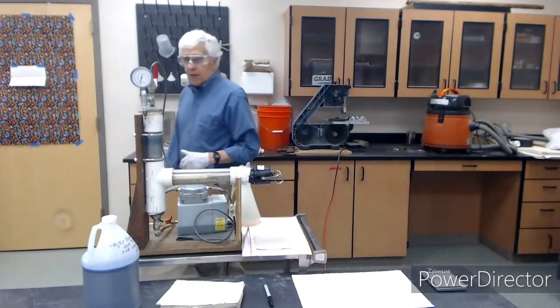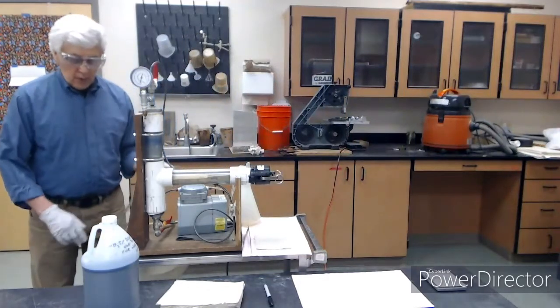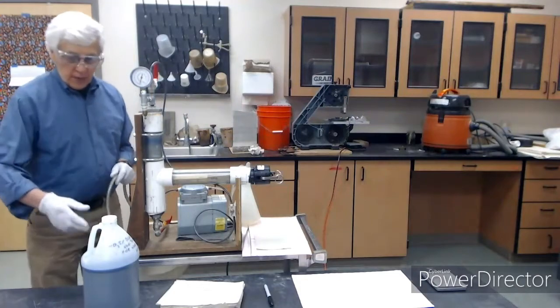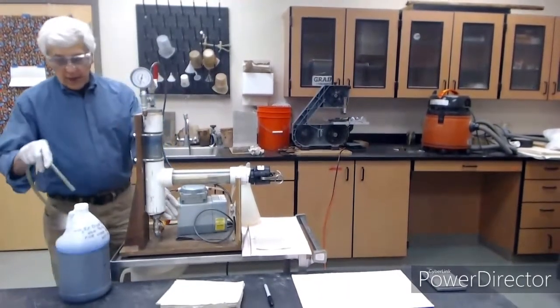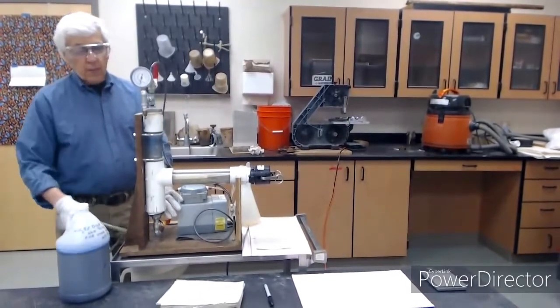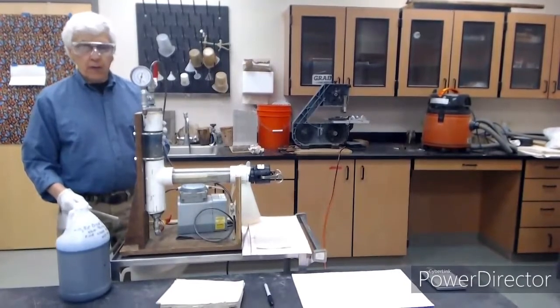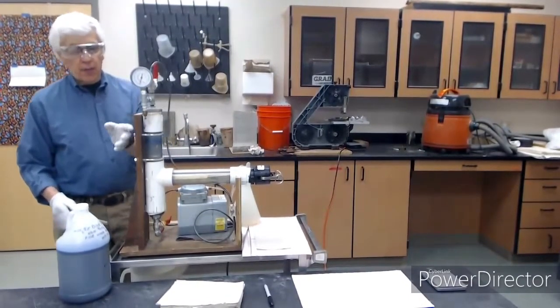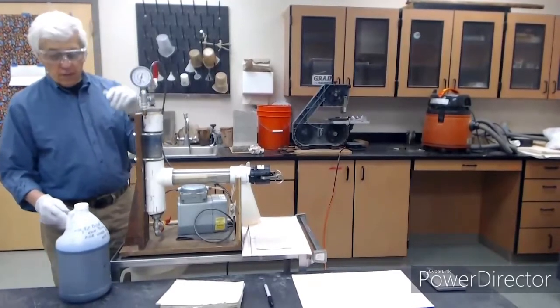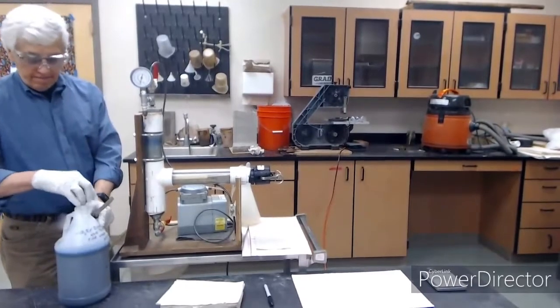Okay, it's been approximately 5 minutes. Now comes the exciting part. We're going to fill the cylinder with our treating fluid by opening the bottom valve, inserting this into the liquid. Opening the bottom valve, the vacuum will suck the liquid up into the cylinder into here. We want to be careful we don't suck it all the way up into the pump or into the valve or whatever. So, be careful.